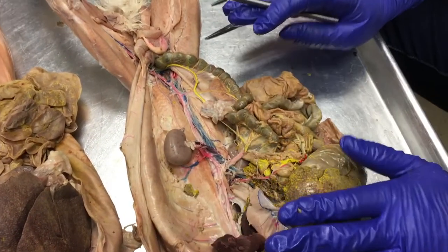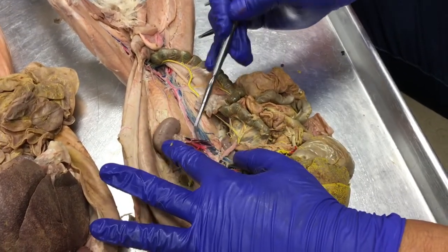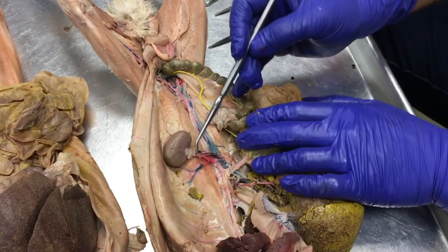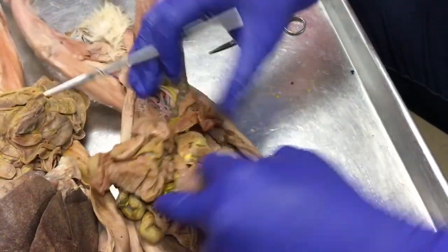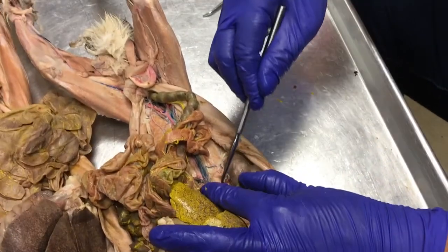That glob of fat contains the adrenal gland. So this artery is feeding the anterior lumbar portion of the spine and the adrenal gland. It's called the adrenolumbar artery. There's one on this side and one on this side too. It's kind of hidden by the kidney, but this is it right here.